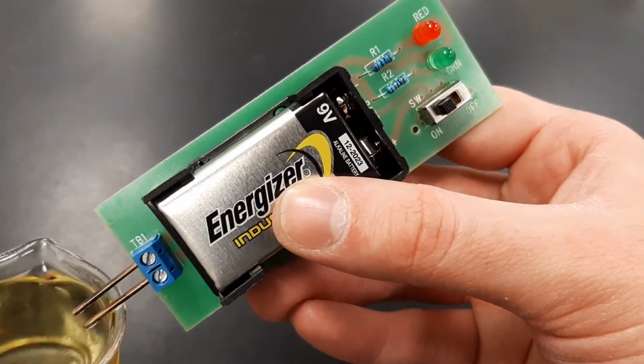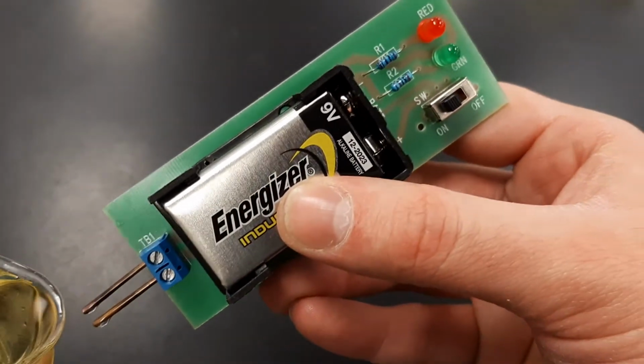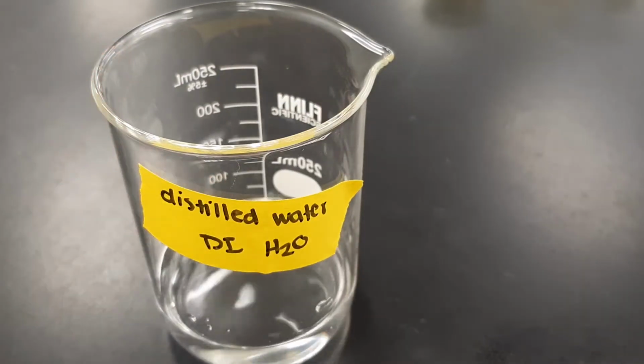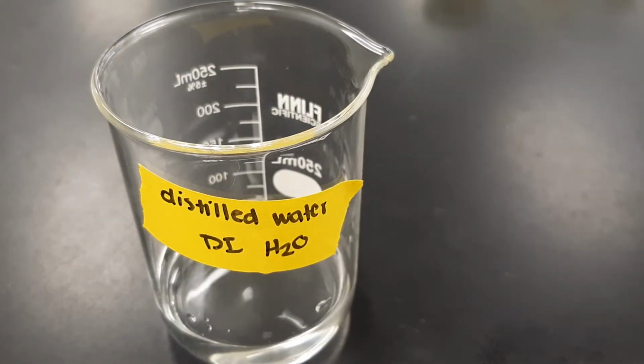Next item will be our distilled water. That is just going to be our pure water.